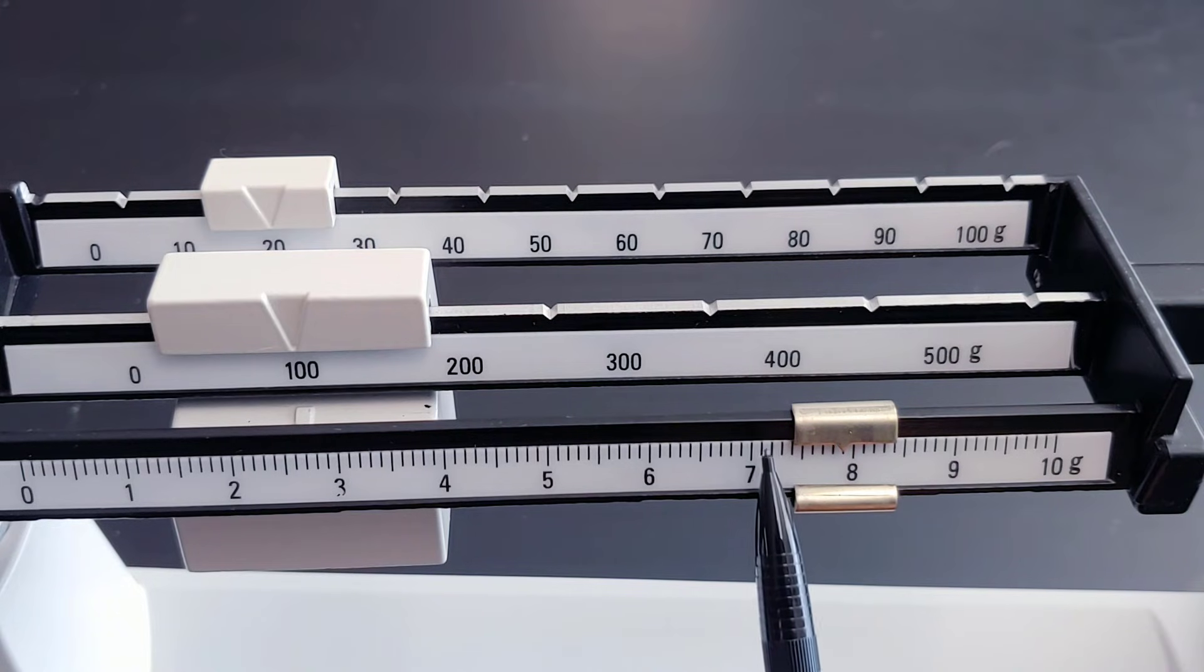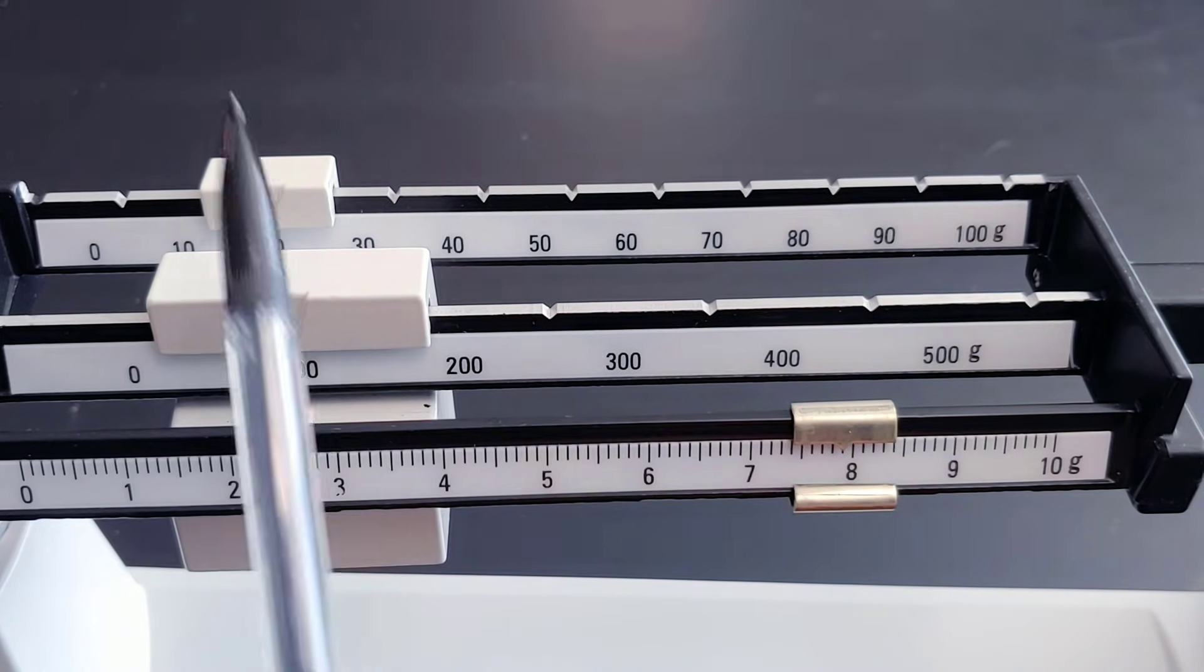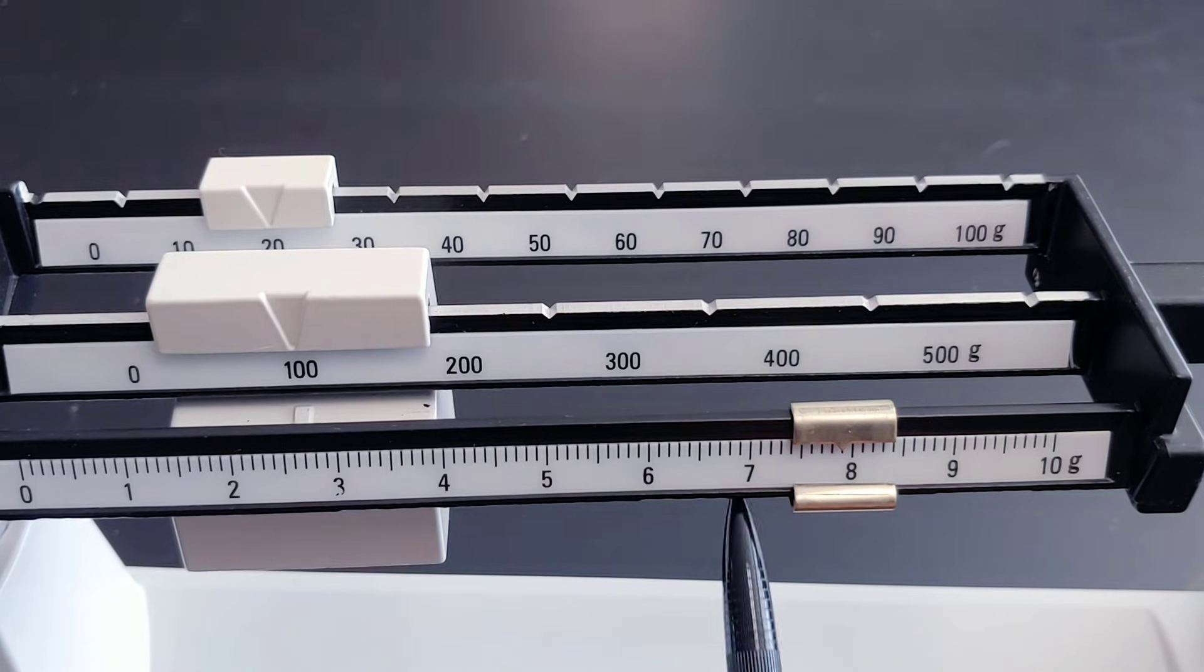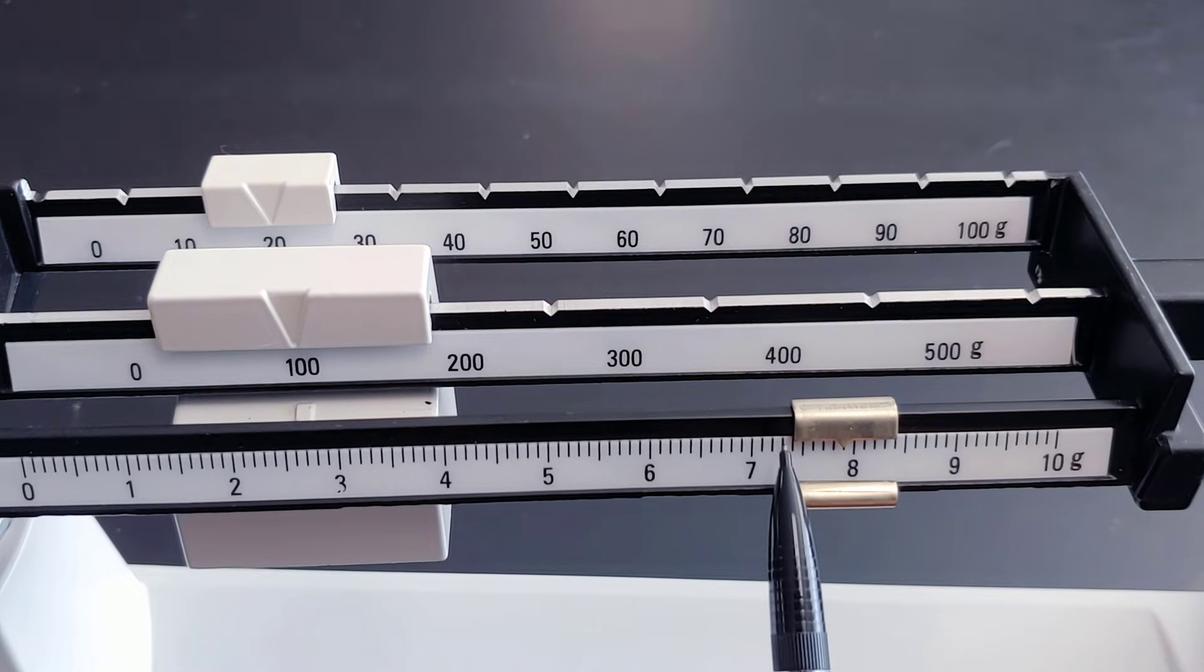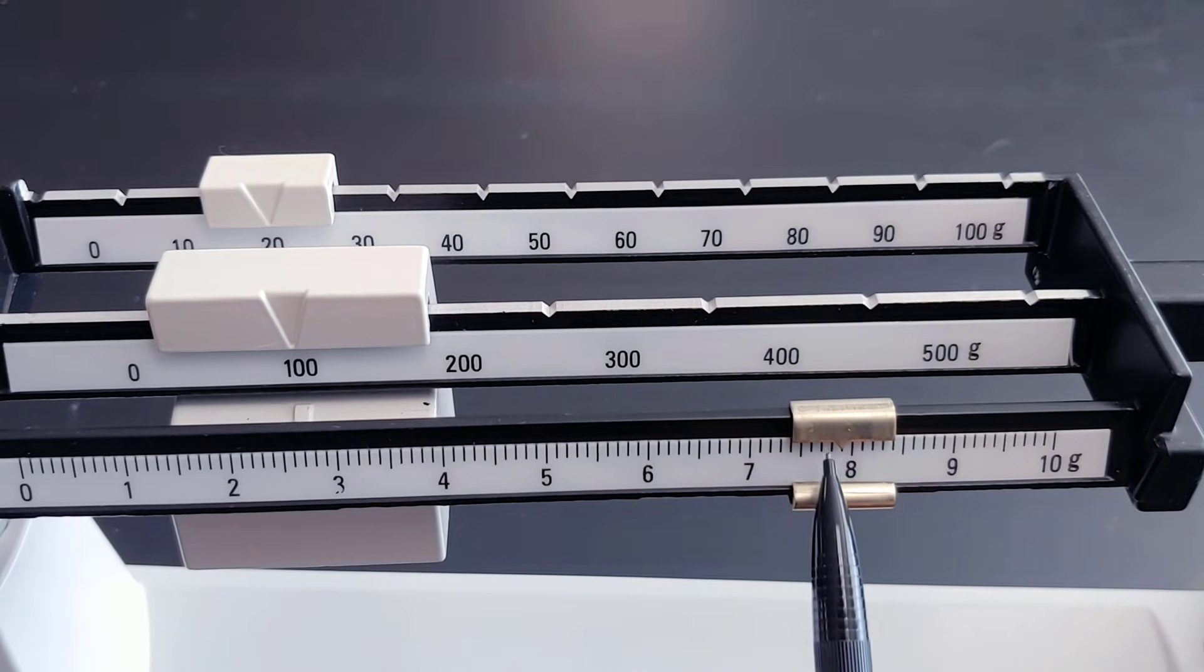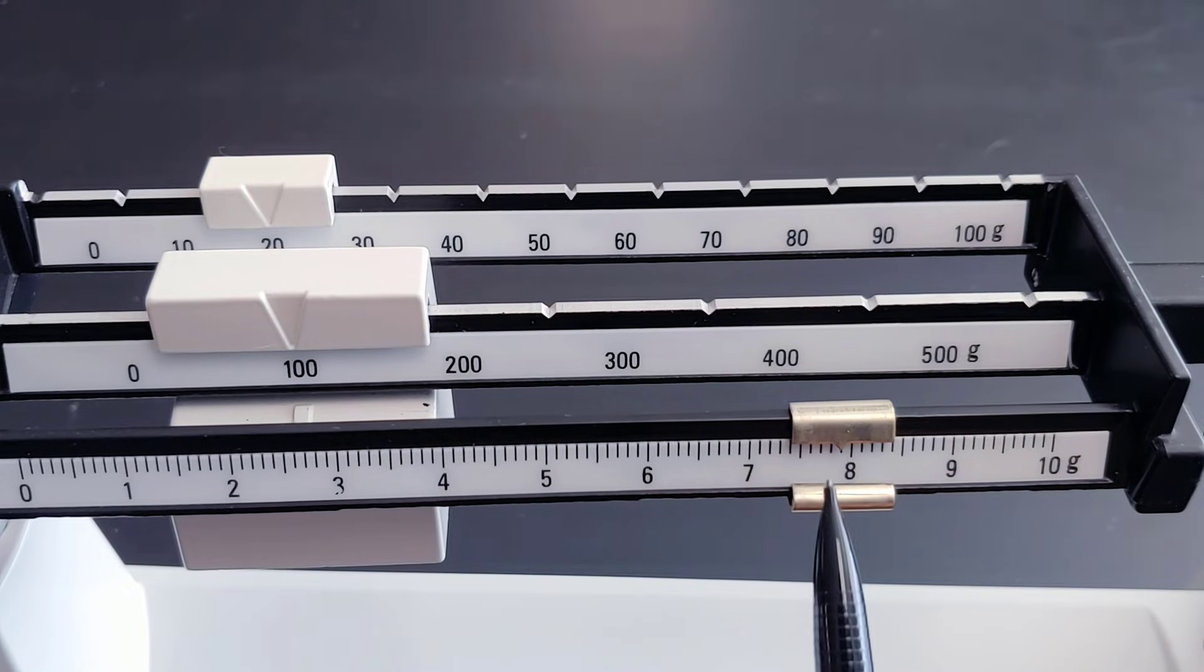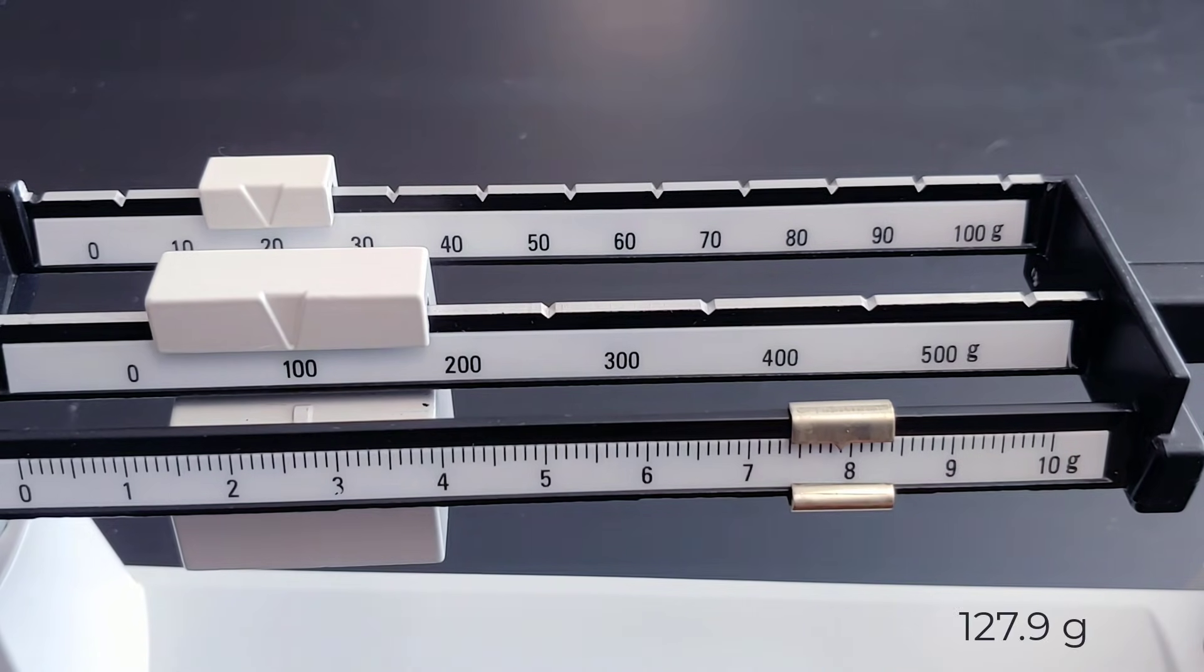So 127 point 1, 2, 3, 4, 5, 6, 7, 8, 9. So 127.9 grams.